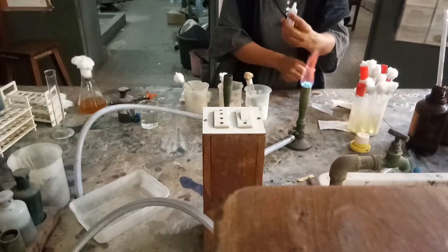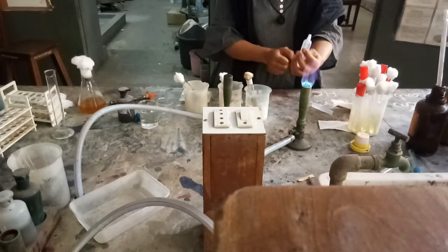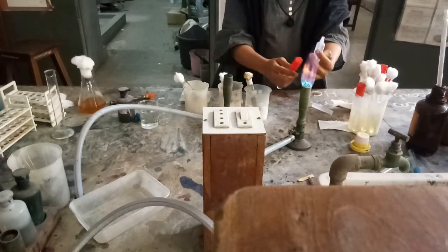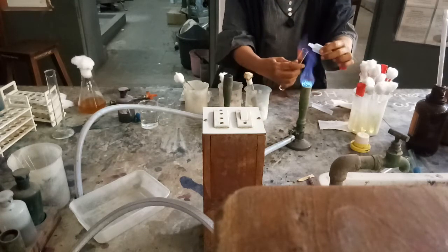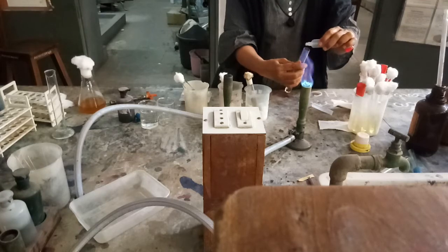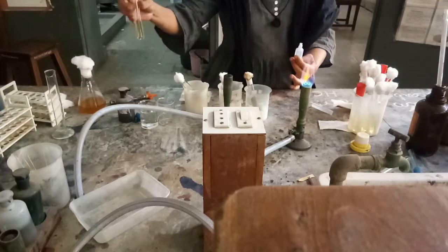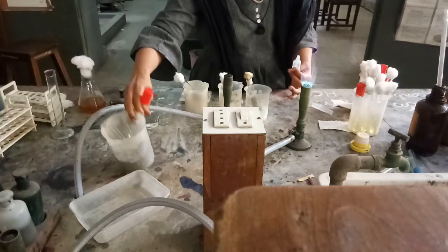Now we will break open the distilled water vial, which is a pharmaceutical product. I will take one thioglycolate broth, open the mouth, and add 0.1 ml. One drop is enough. It is inoculated and I will keep it to one side.